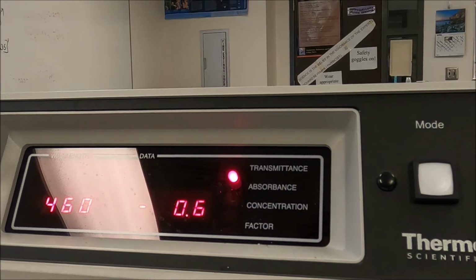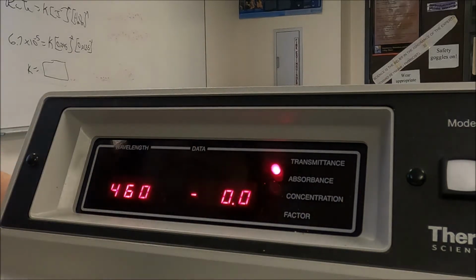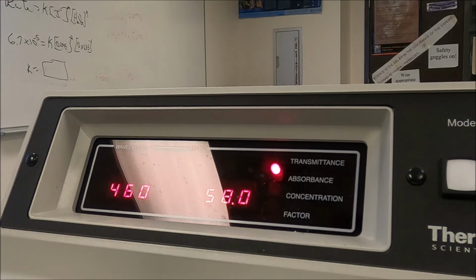Okay? Make sure that that's reading 0. Pop in the distilled water. And check the 100.